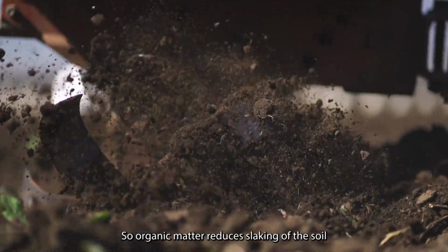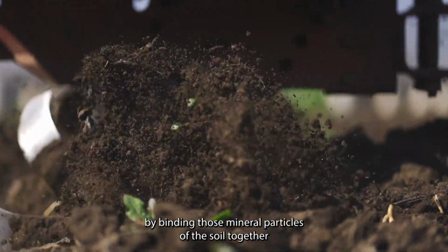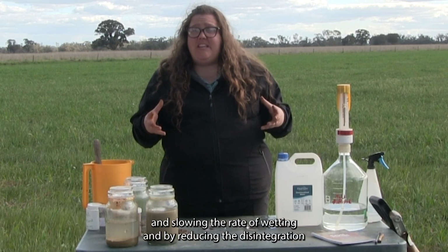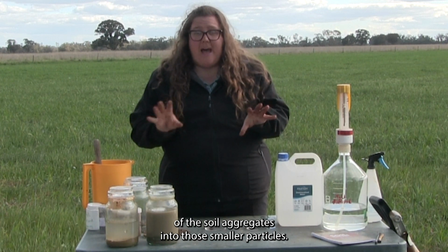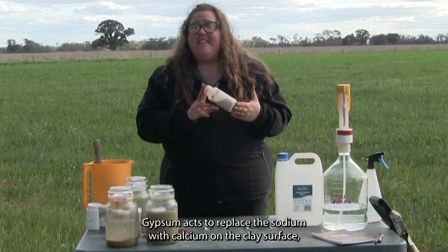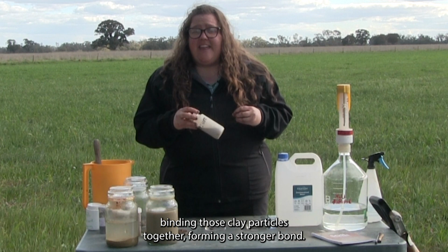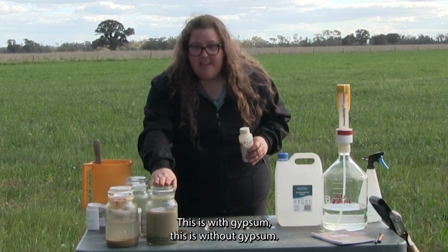Soil organic matter reduces slaking of the soil by binding those mineral particles of the soil together and slowing the rate of wetting, and by reducing the disintegration of the soil aggregates into those smaller particles. Gypsum acts to replace the sodium with calcium on the clay surface, binding those clay particles together, forming a stronger bond. This is with gypsum, this is without gypsum.